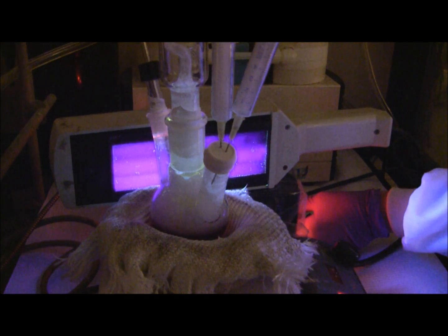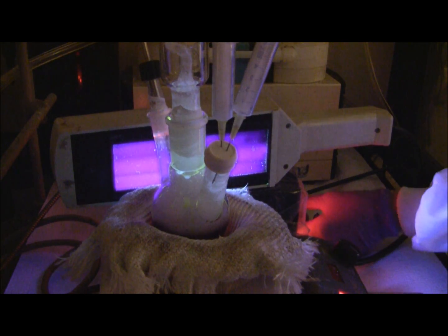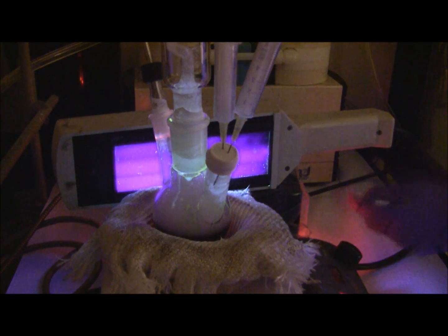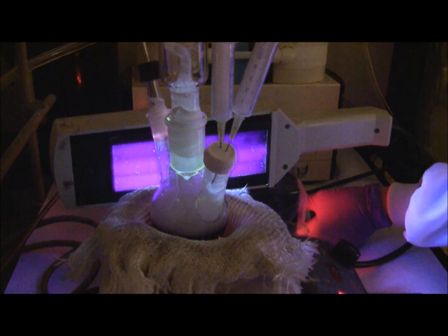I'm going to lower the temperature to 290 degrees to anneal it. You can see at the beginning it fluoresces green, but as it heats up it turns to a more red color.